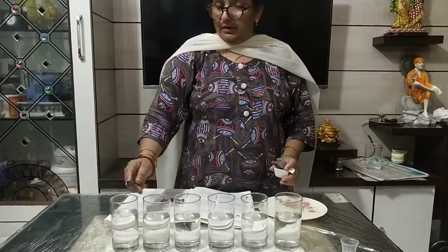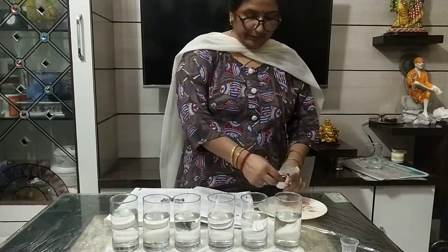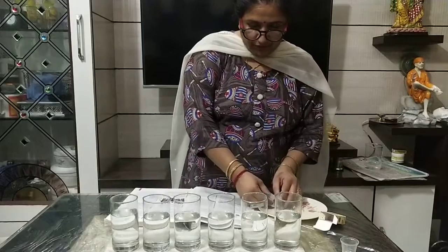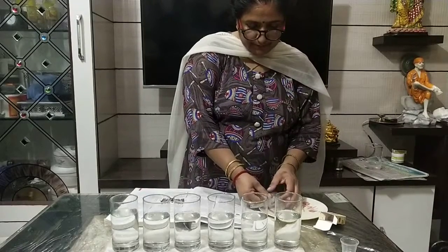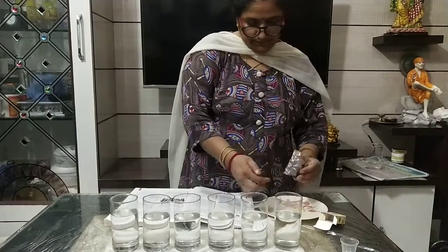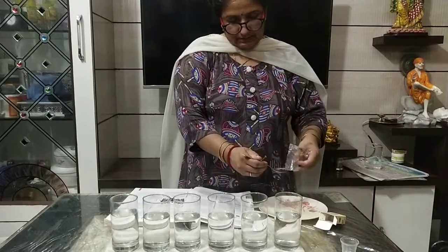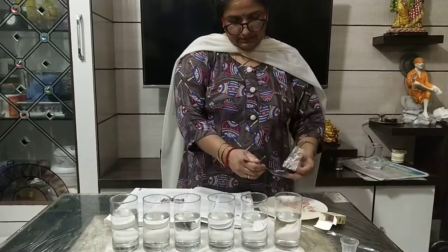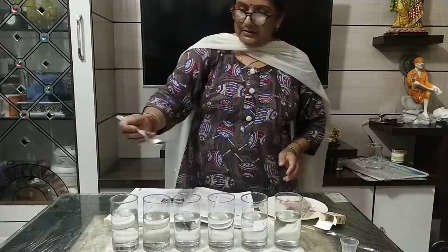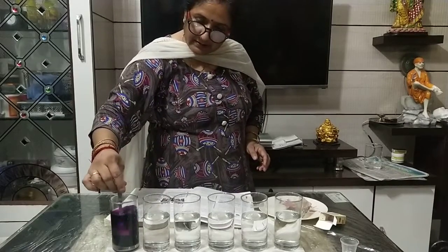This is the first glass — it is having 100 millilitres of water. I am taking a small amount of potassium permanganate. It seems to be violet in color. Just take it and see the color of the solution.